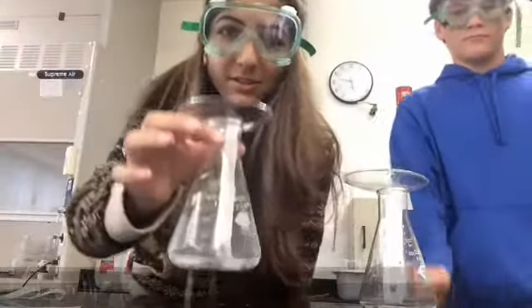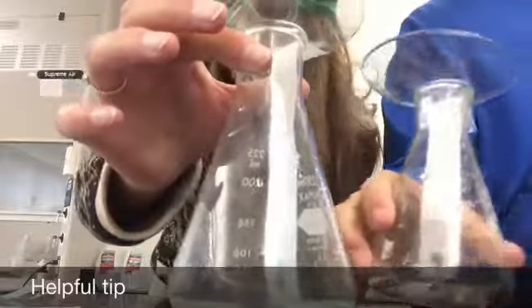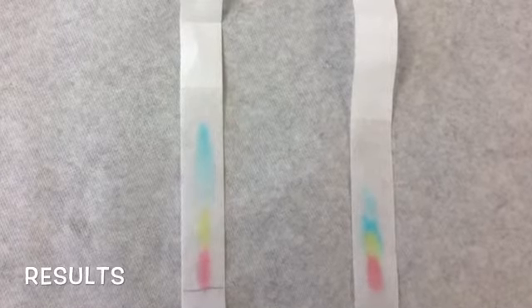Notice we're not getting the solvent anywhere above the tip of our dye sample, because if we did, then the samples will dilute into the solvent. As you can see, on one of the chromatography strips, the dye traveled further and separated out more. So now it is up to you to eliminate one and take the other one and test the effects of different concentration on the dye.